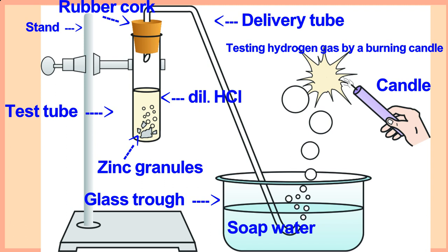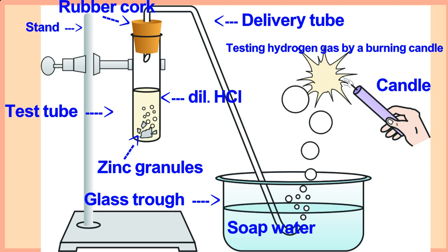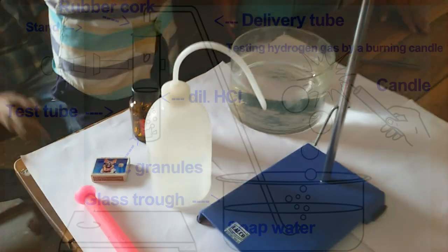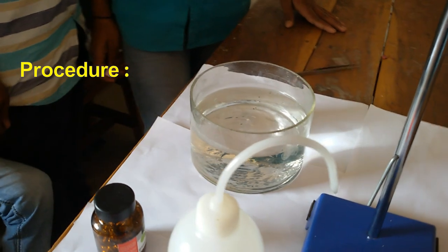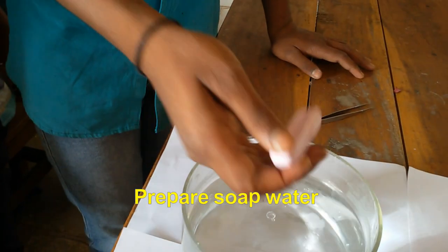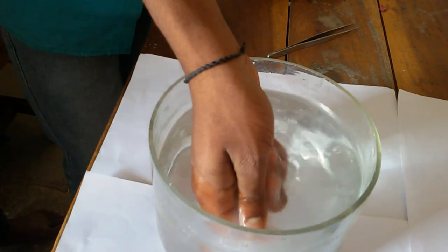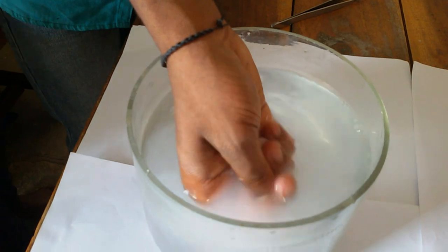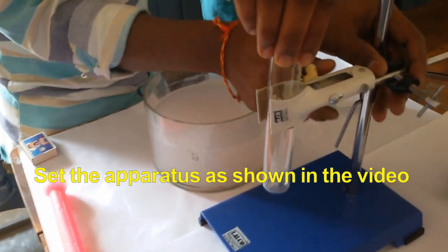Observe carefully here. Arrange all apparatus like this: stand, test tube, delivery tube. Now let us do the activity. First, prepare soap water. Set the apparatus as shown in the video.